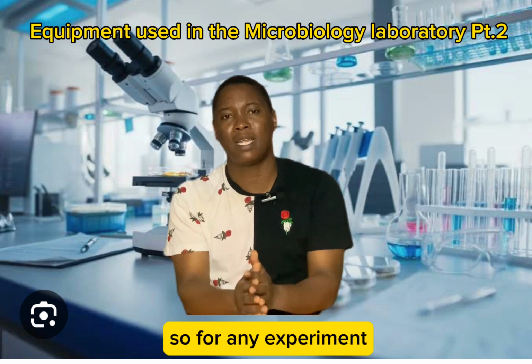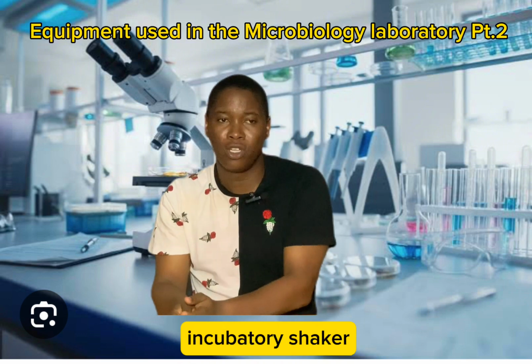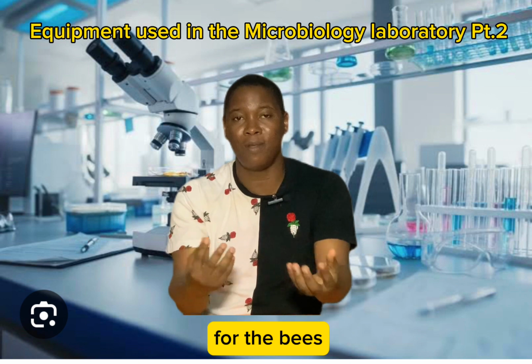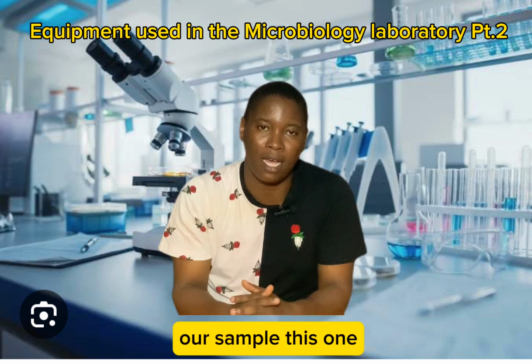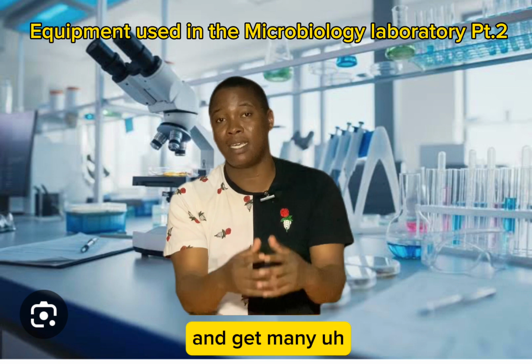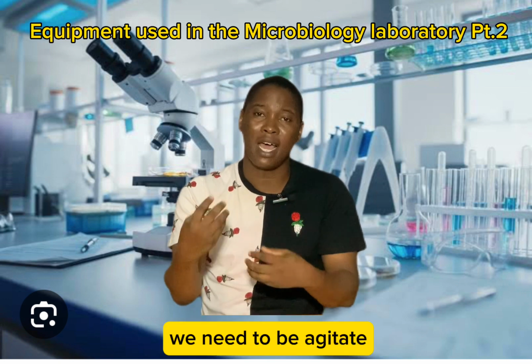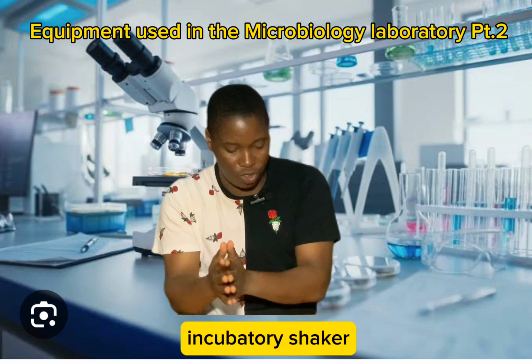So for any experiment like that, we dey usually put am inside wetin we dey call incubatory shaker. So that thing na incubator normally, then e come get some things for the base wey go dey help us dey agitate or dey shake our sample. This one dey important, and e get many experiments wey we dey do wey be say we need to dey agitate those samples. So that equipment dey, we dey call am incubatory shaker.